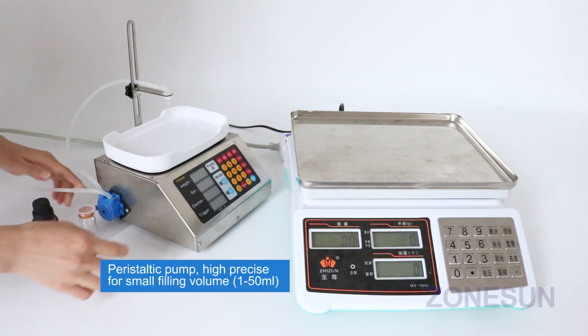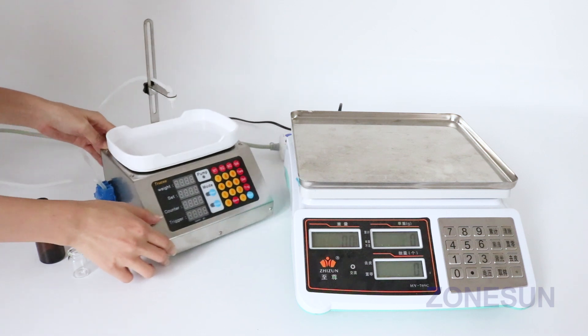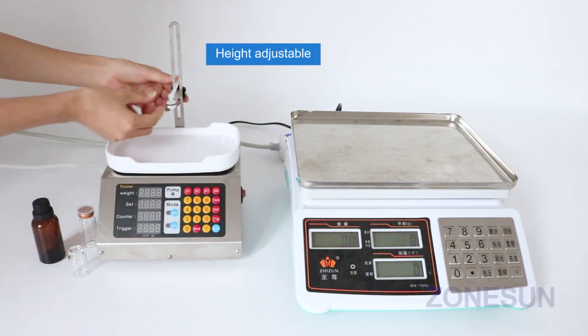This machine is a peristaltic pump. Very classic. You can adjust the height.